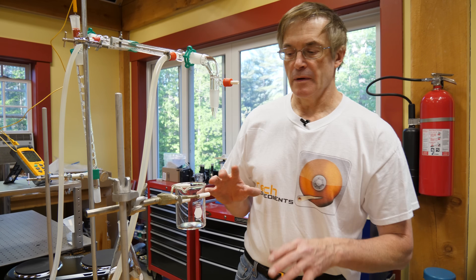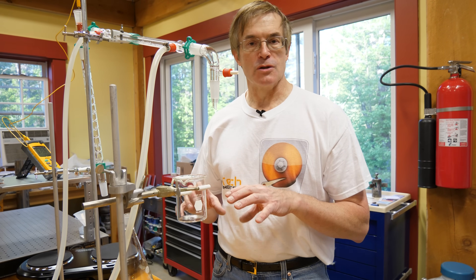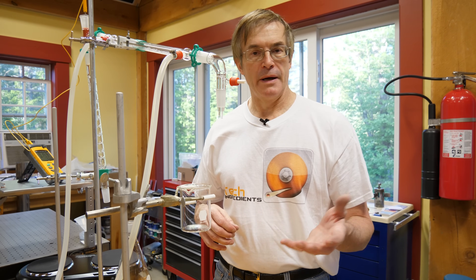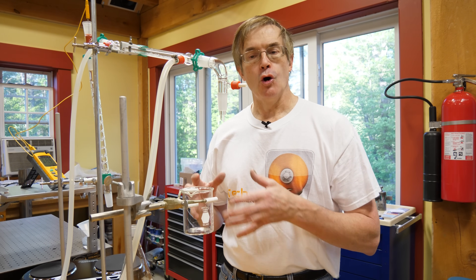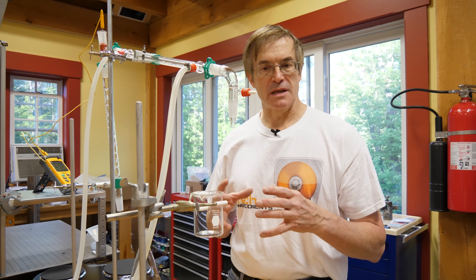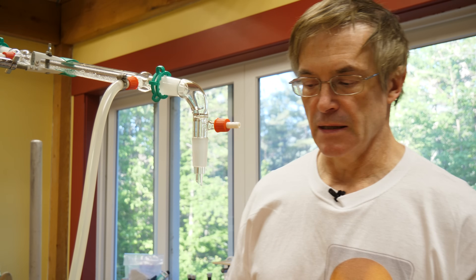So now let's review some of the principles behind distillation in a laboratory setup. To begin with, distillation is not a discrete process. You don't take two fluids with different volatilities, mix them together, and end up with pure one and pure two. It's always a matter of favoring the movement of the more volatile fluid or vapor over the less volatile one. You'll always get a mixture of the two, but you'll concentrate it based on when you sample or take the distillate out.